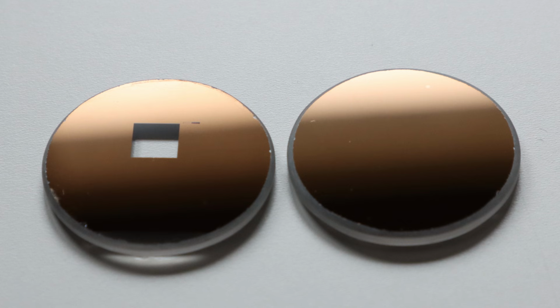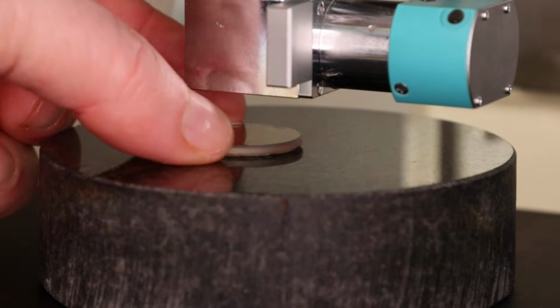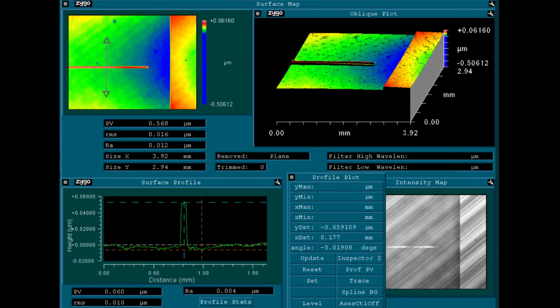So here is the sample that we've just looked at. For the first measurement, we'll use the lowest magnification with the 2.5 times Michelson objective. Unfortunately, even with this magnification, we can only observe a small area of the pattern. We can now do a scan in the Z direction and see the coherence pattern scan smoothly over the surface, and then look at the data generated by the software, showing a very detailed height map of the surface.